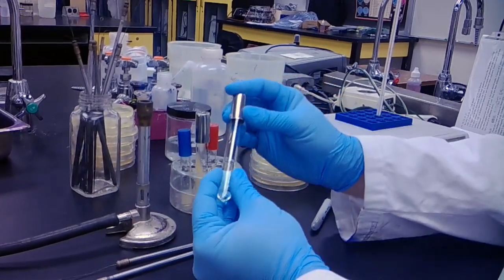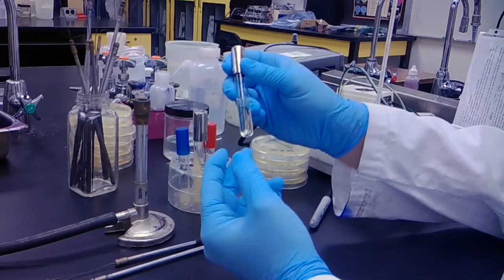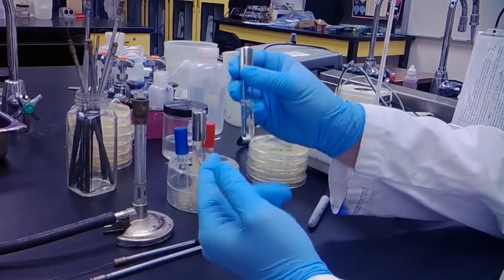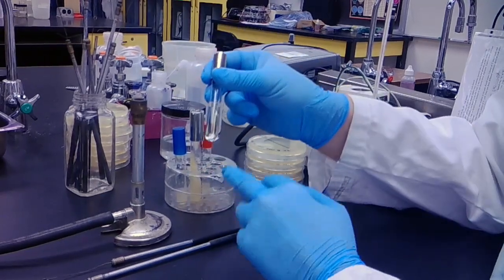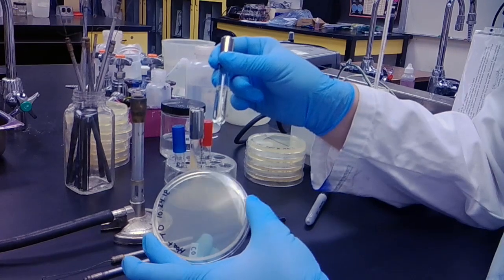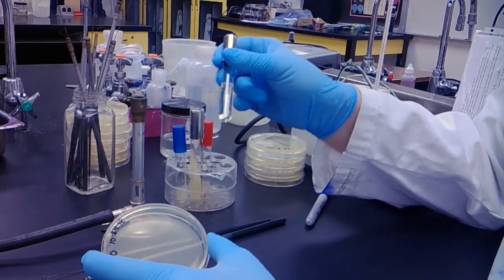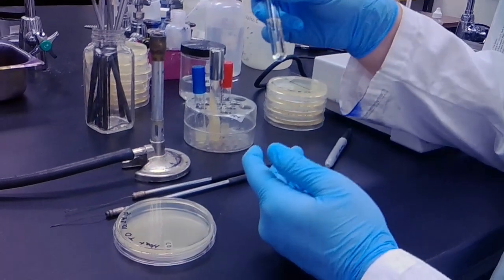Now I'm going to rack this colony a little bit, try to mix it up before I spread it. When I'm spreading this onto my plate for time zero, I want to spread this as if I was spreading it to isolation as we did in the previous lab.